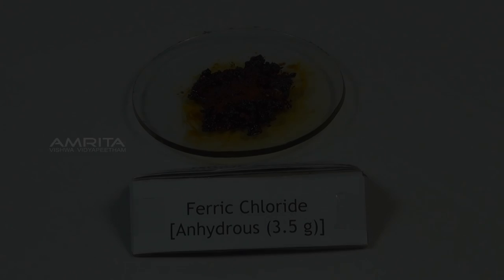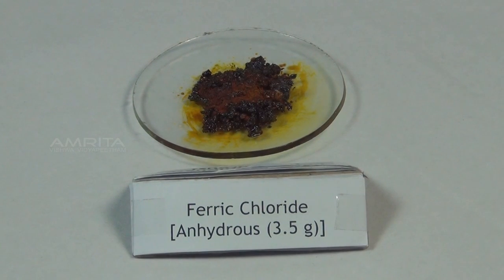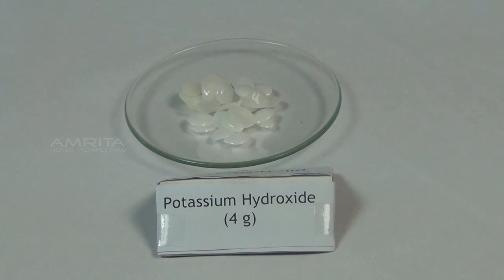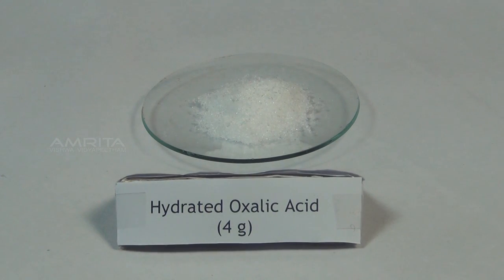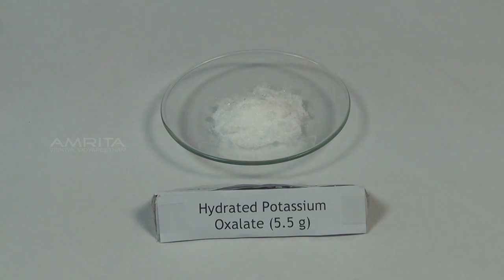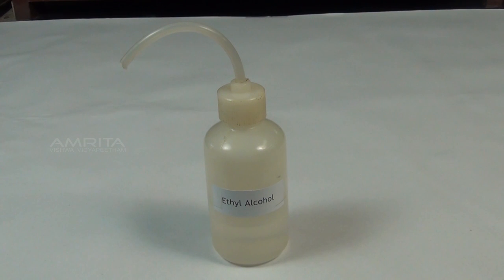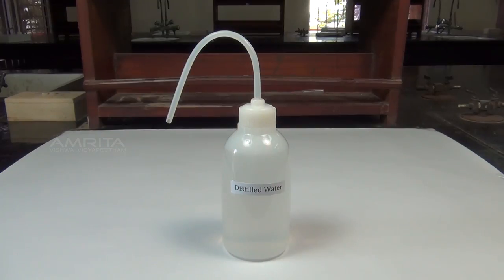Materials required: 3.5 g anhydrous ferric chloride, 4 g potassium hydroxide, 4 g hydrated oxalic acid, 5.5 g hydrated potassium oxalate, ethyl alcohol, and distilled water.